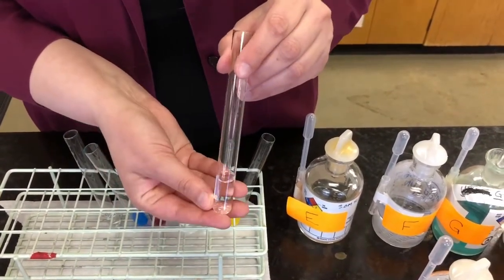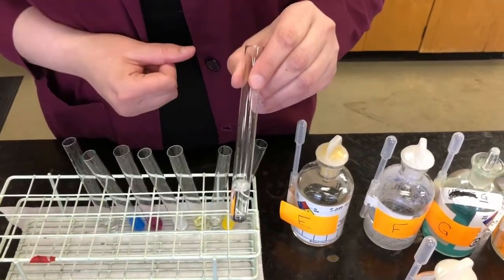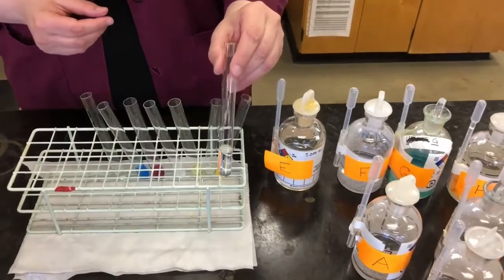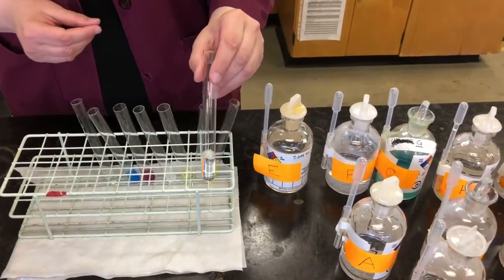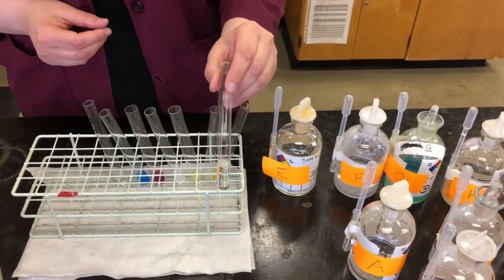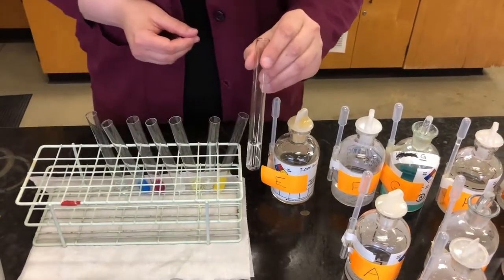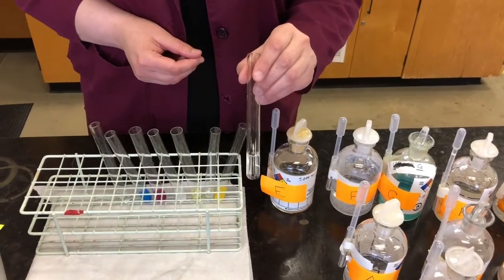So you're just gonna have to take my word for it. But the test tube is warm, okay? So our observation is that the test tube became warm, our deduction will be that E and I reacted to produce heat. So that's our deduction based on our observation.